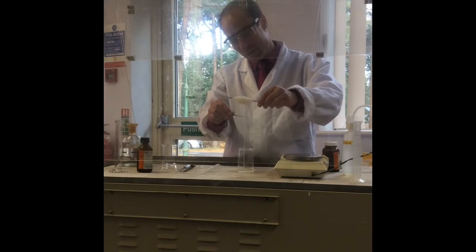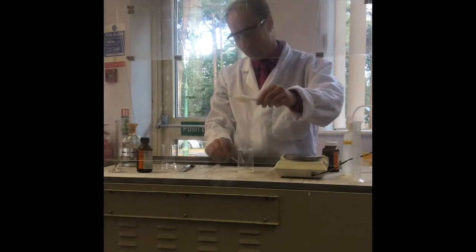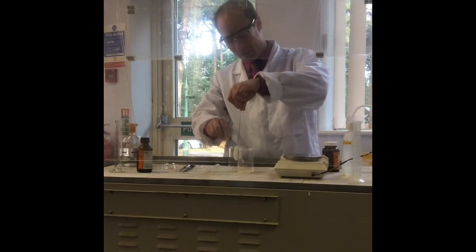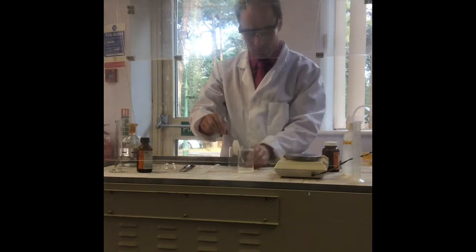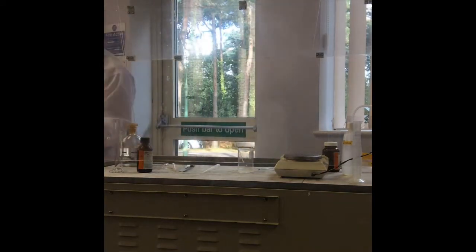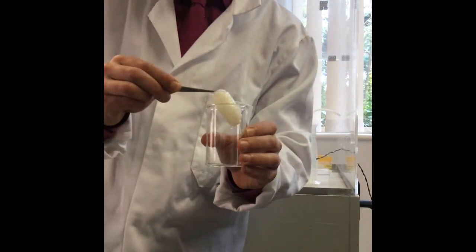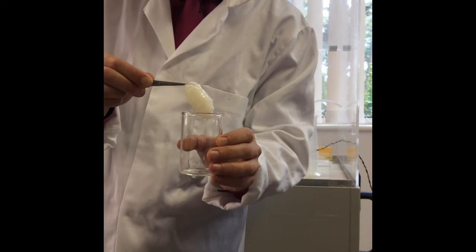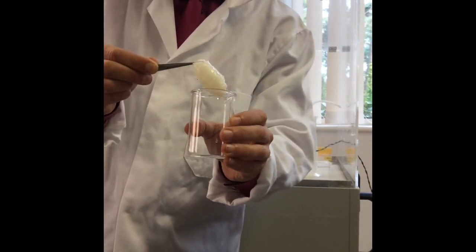So if I cut it off, and then I will pop it in here, you can come over here and show the camera. Oh, it looks like a cocoon. Yeah, it is very much like a cocoon. So there you go. Oh, it looks like gnocchi. Like the potato stuff. Yeah, cool. And there you go. That's nylon.